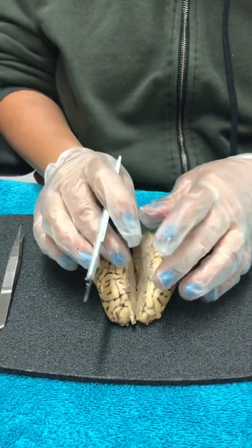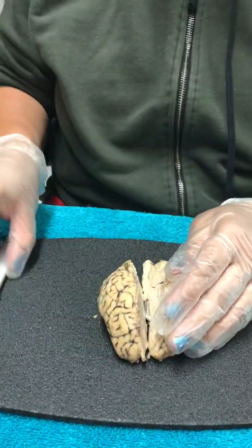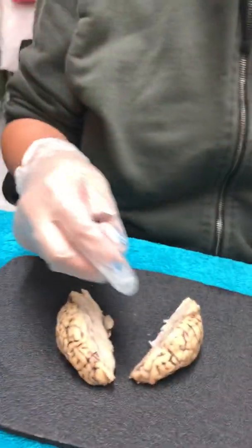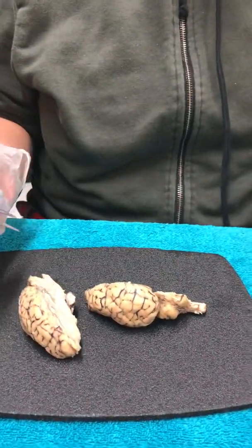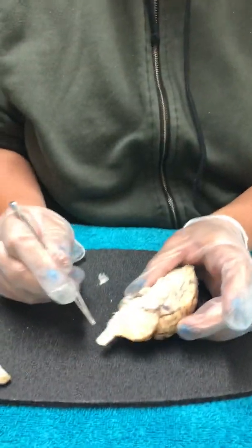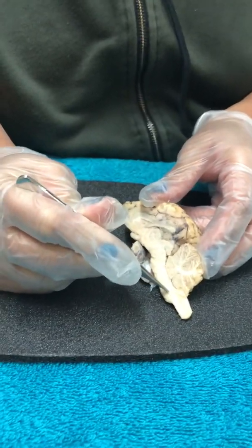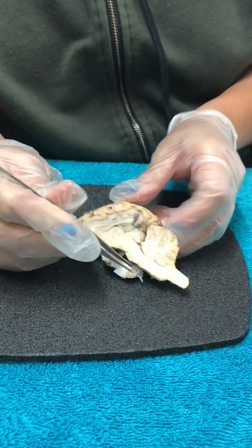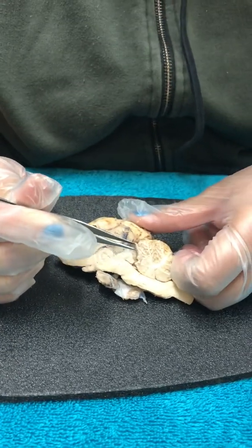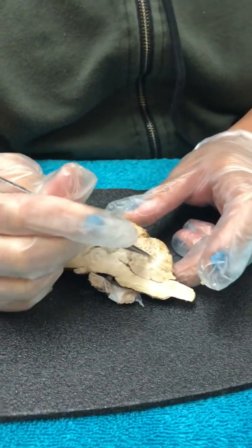You have to dissect very carefully so you can see good anatomy of the brain. So let me get a different tool so I can pinpoint the proper location of the structures. Right here you can see the sheep brain. We can go from here. This is the spinal cord. When you go up, this is the medulla oblongata. And then here, this is the cerebellum. The cerebellum is right here, and it's for muscle coordination and balance.